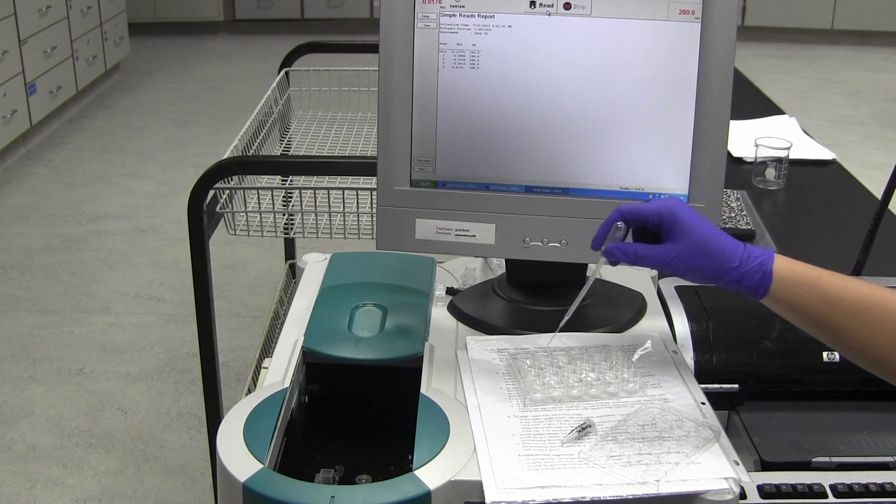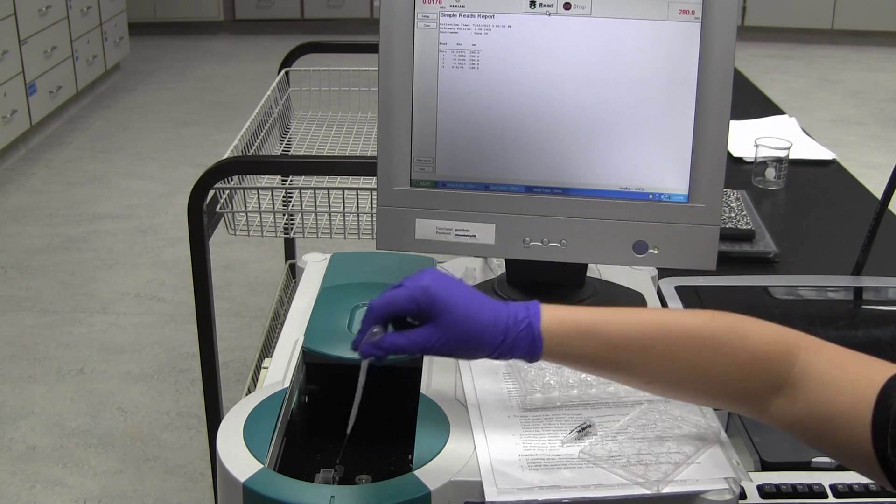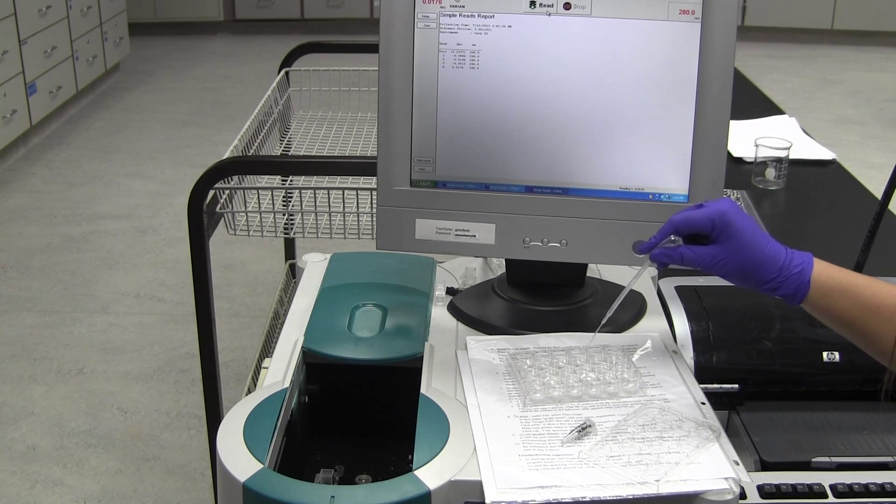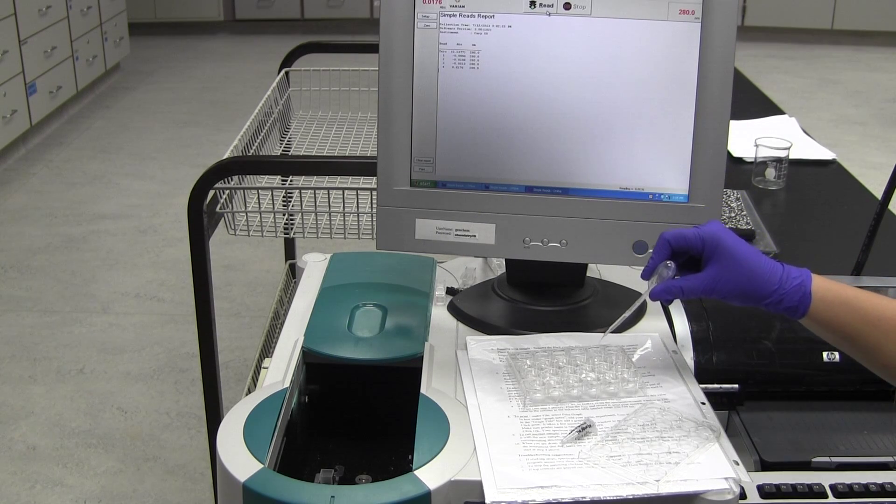From there, load your next fraction and continue collecting. You do not need to clean out the cuvette in between fractions, but make sure to remove all of the liquid when you switch from one fraction to the next.